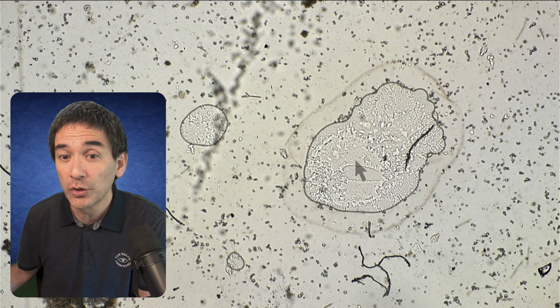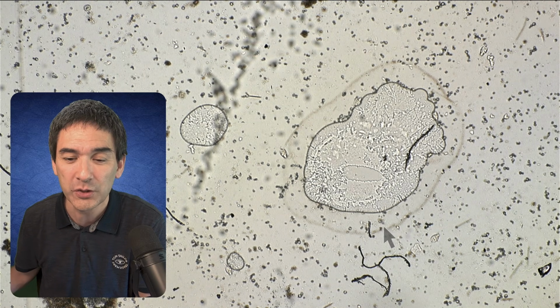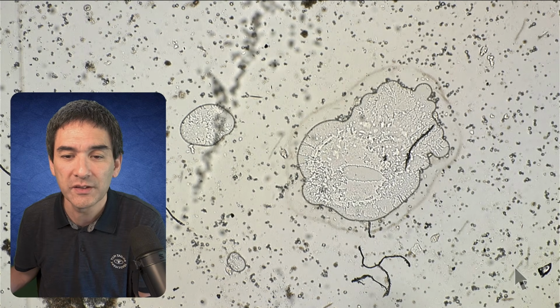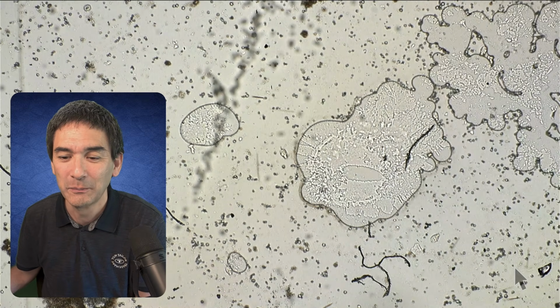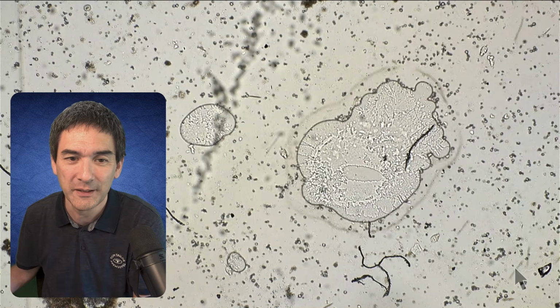Now, as the oxygen of the air bubble is used up, there is less and less oxygen present, and that's why they will move closer towards the air bubble. That's something that we're able to see over here, right? So now it's barely touching the air bubble, and then of course everything's completely dried up, and then we've got air bubbles also moving in from the side.